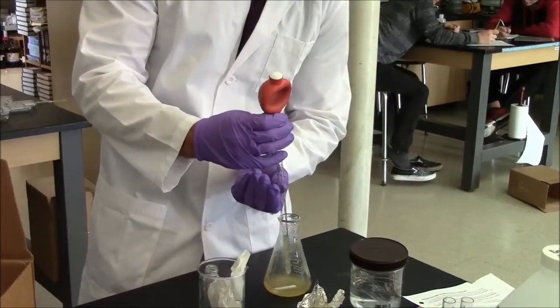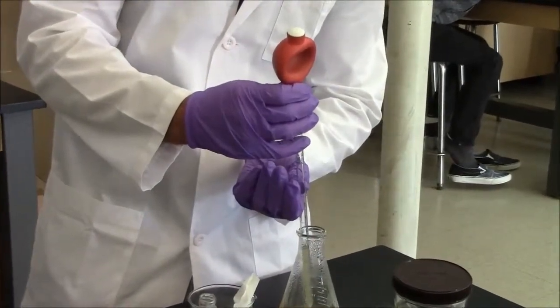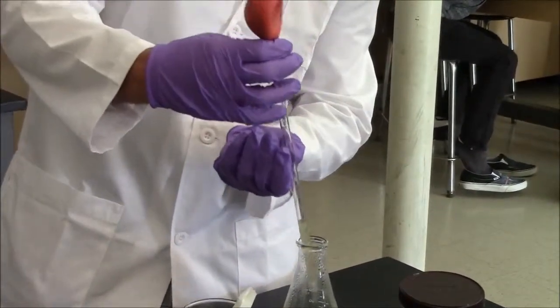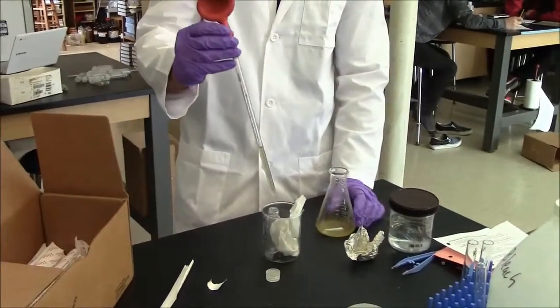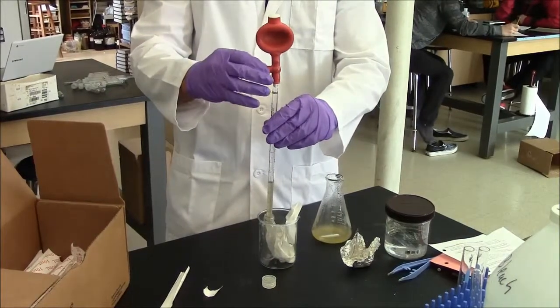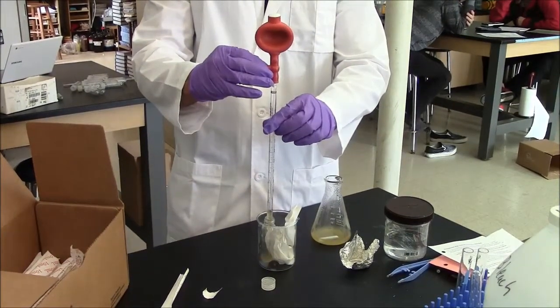Here you can see Chad is pulling up 5 milliliters into the pipette using the up arrow on the bulb. And then he can transfer those 5 milliliters of cells into the centrifuge tube, pressing the down arrow to deliver the contents.